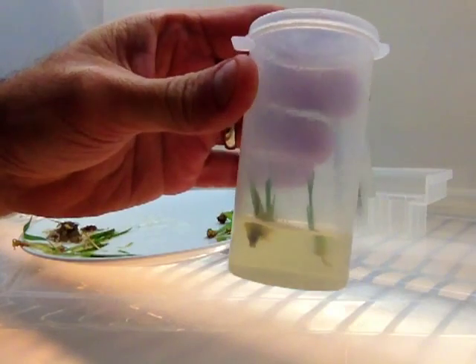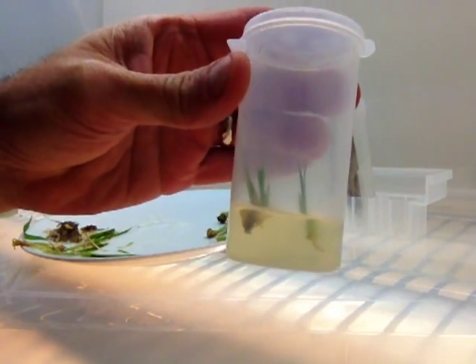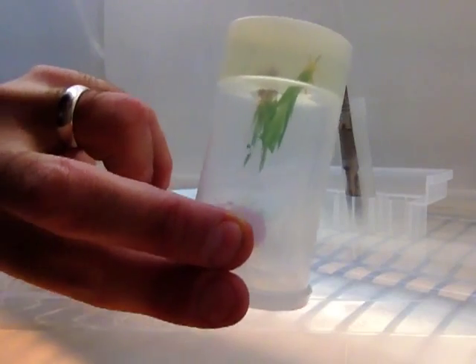They're just about a quarter inch in — enough to hold it in place. It's not going anywhere.